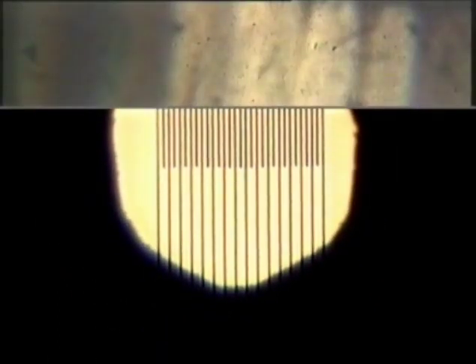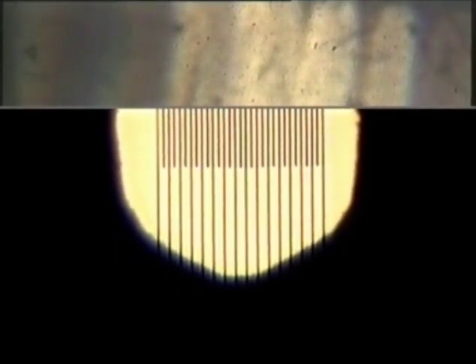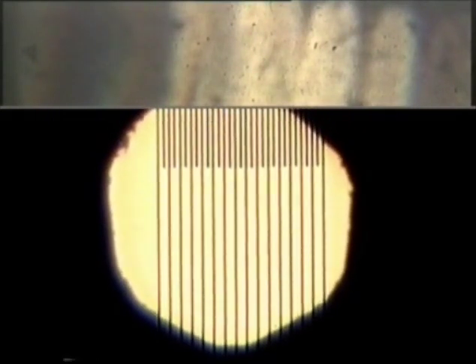Before we carry on, I need to focus my condenser on the illuminated field diaphragm like that, and since we'll be using it in the lower half of the screen, I'll lower it down a little like that. So there we have that ready to go. And strictly speaking, up at the top of the screen you should be seeing a diffraction pattern of the grating that lies at the bottom.